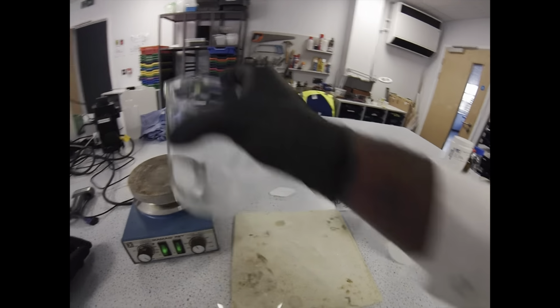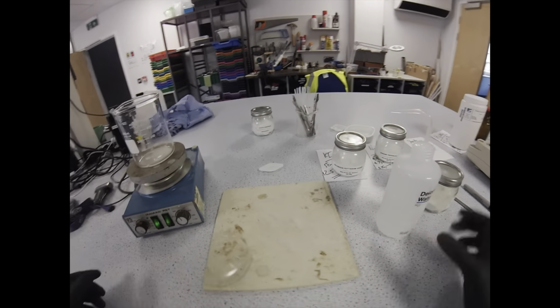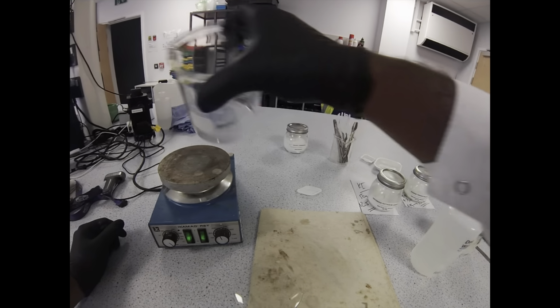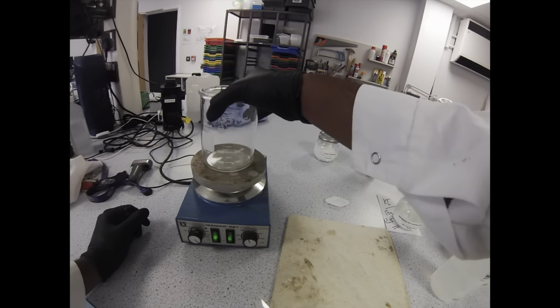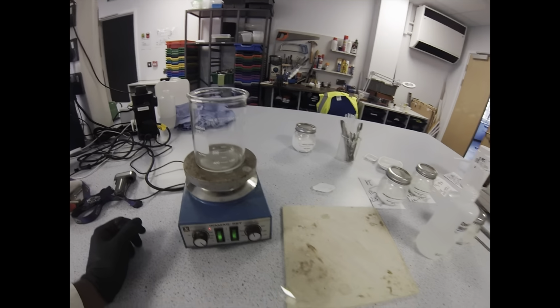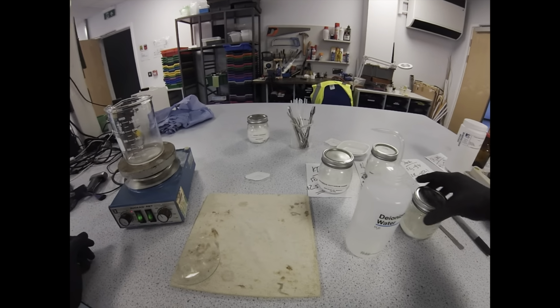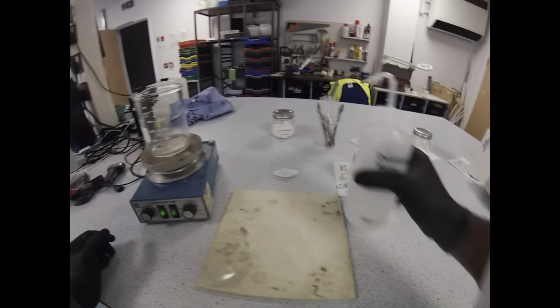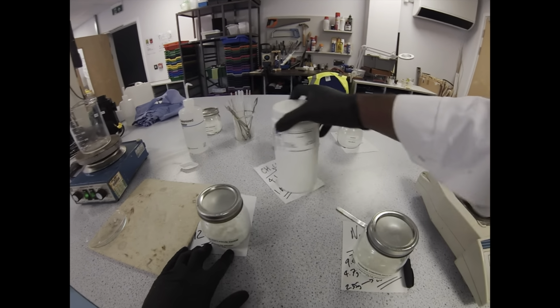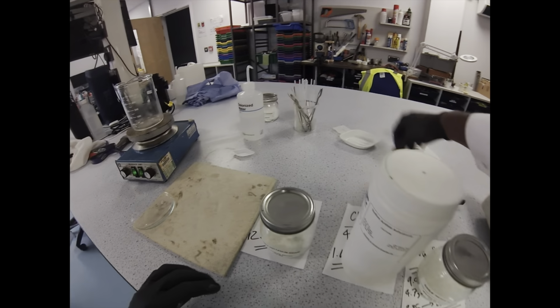So that goes onto the hot plate now, and I don't really want to do too much else while that's heating. I really don't want to get distracted and let that burn. Just want to get past the initial heating while the solution is quite thin. And then once we've topped up with a bit of water, we'll be fine to let that go. Just while I'm waiting, I'm just going to organise my life a little bit. These are the powders that I've got to weigh next.